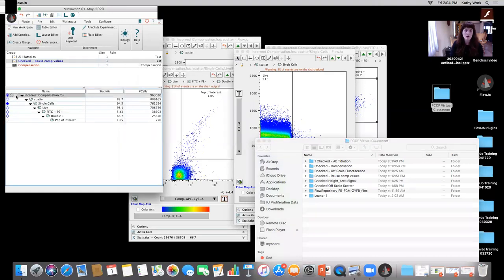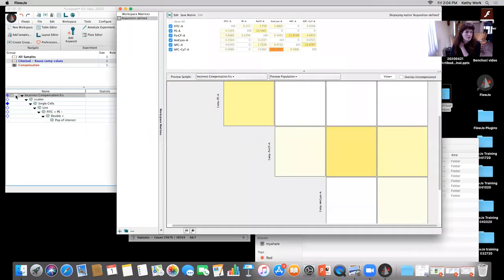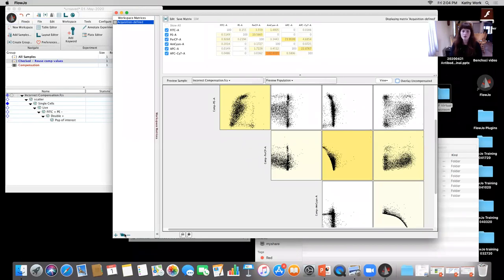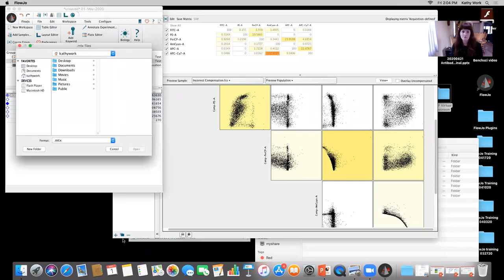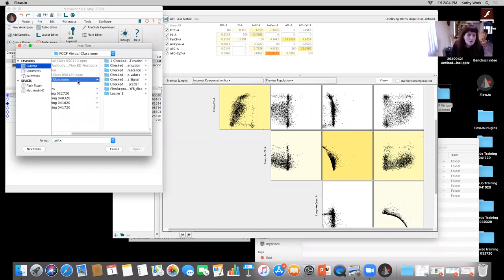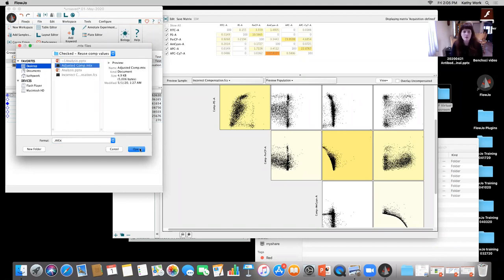So for this user, I just resaved the compensation matrix. What I'm going to do is double click here. This is the acquisition defined matrix, and I'm going to add in a previously saved matrix that I had used to correct this with the appropriate controls. So I'm going to hit add, I'm going to hit from file, and I have it right on the desktop here. Okay. Virtual classroom, adjusted comp matrix. I'm going to open that up.